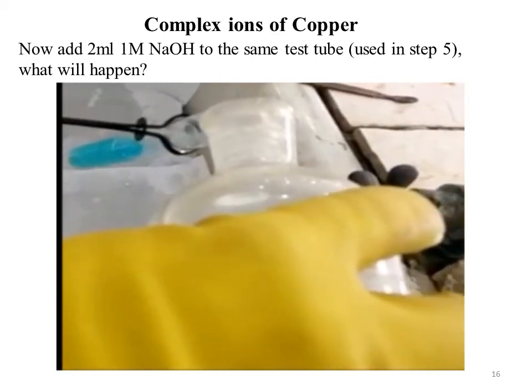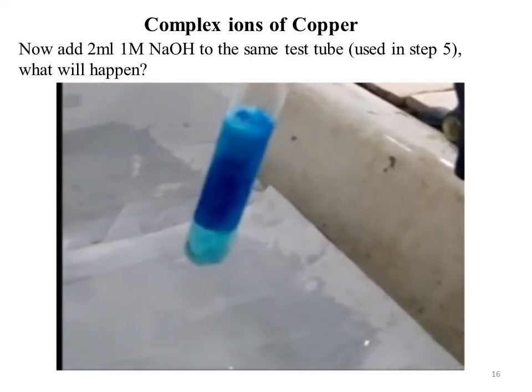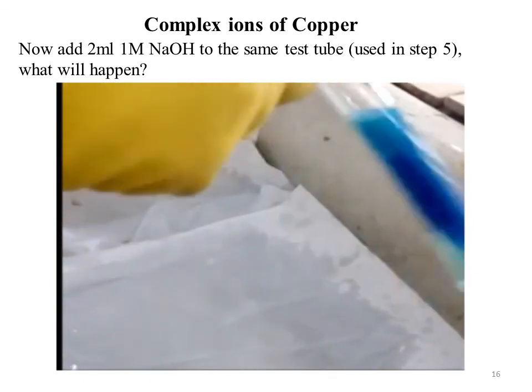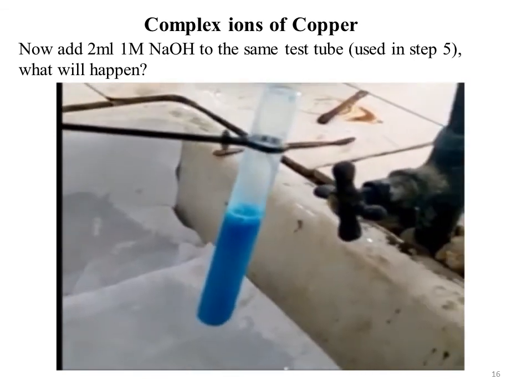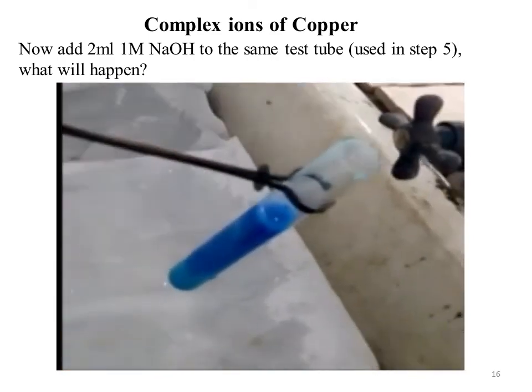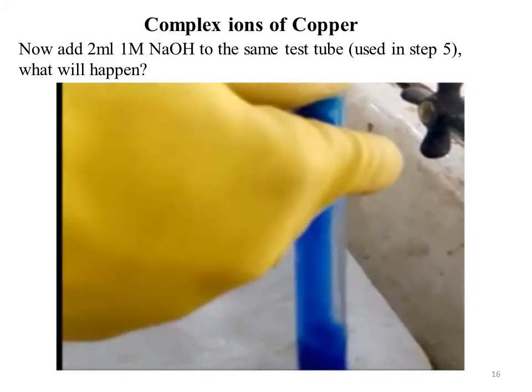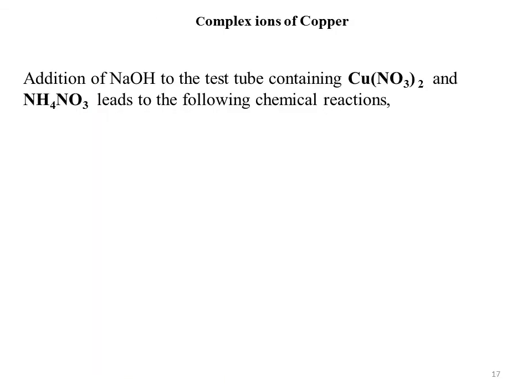Now see in the video, there is an appearance of royal blue color, indicating the formation of tetraamine cuprate(II) ion complex. When more sodium hydroxide is added, the royal blue color complex formation is more clear. What happened there? Addition of sodium hydroxide to the test tube that contained copper nitrate and ammonium nitrate leads to the chemical reaction as follows.